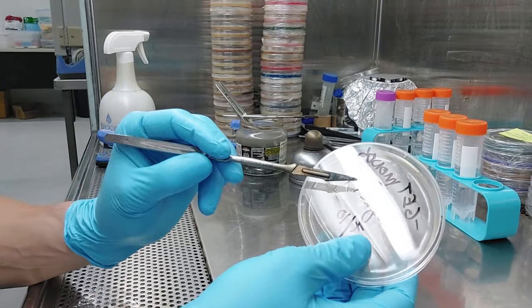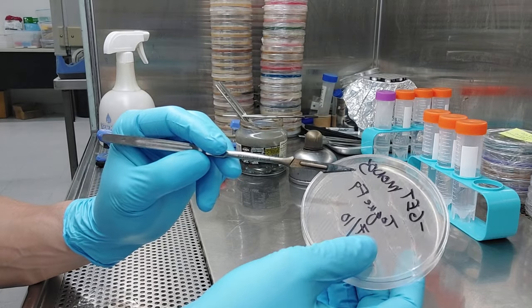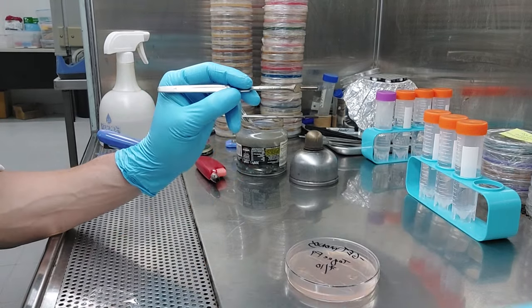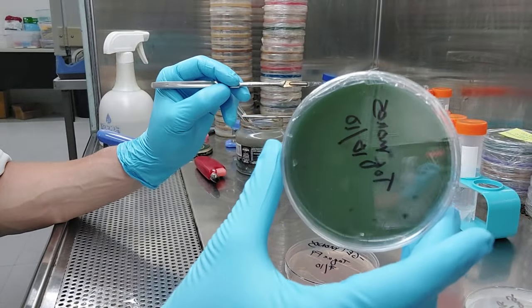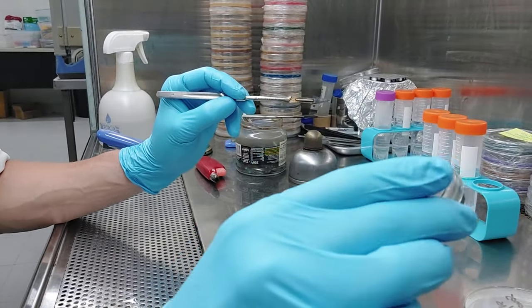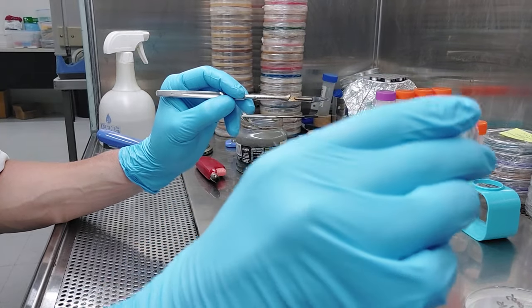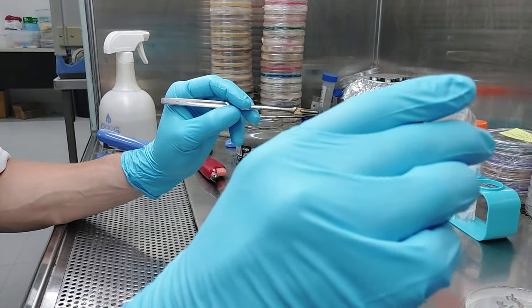I don't know where the camera is. I put four, I did that four times on this plate. I put four of them on there and I put four on this one. Again, I don't want to move those, and I hope I just didn't on accident.